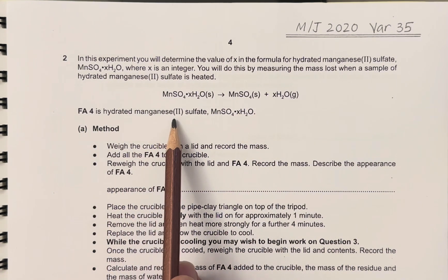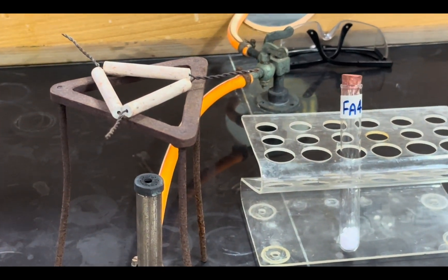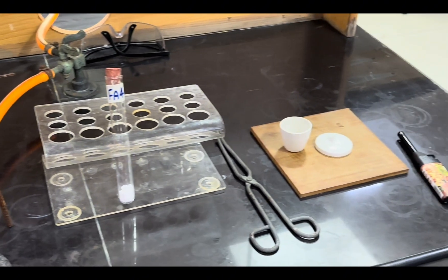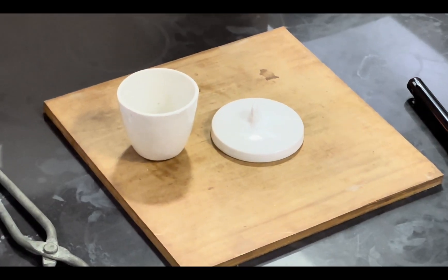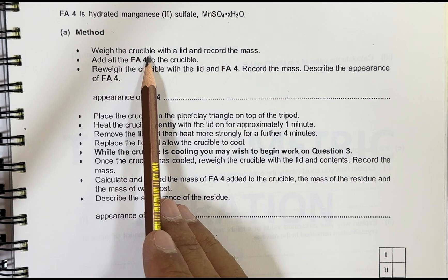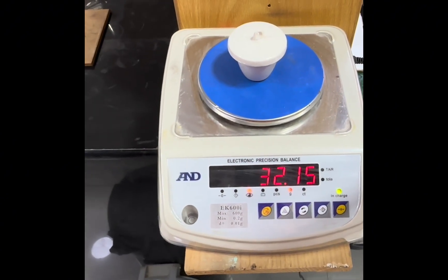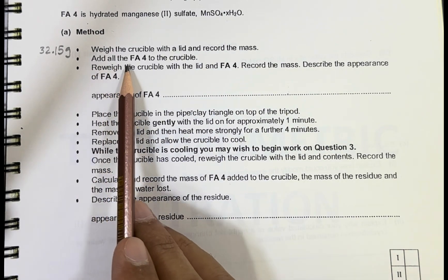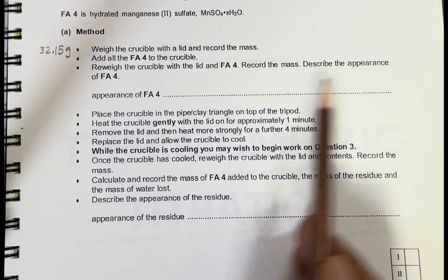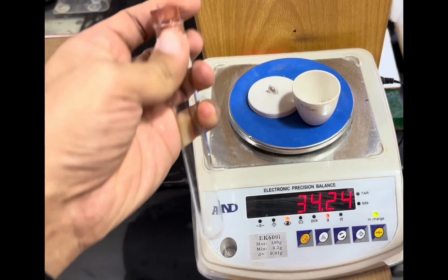FA4 is hydrated manganese 2-sulfate. The apparatus and chemicals given are: a Bunsen burner, a tripod stand, a pipe clay triangle, FA4 white solid in a test tube, a pair of tongs, a crucible with a lid, a heatproof mat, and a lighter. Method: weigh the crucible with the lid and record the mass.